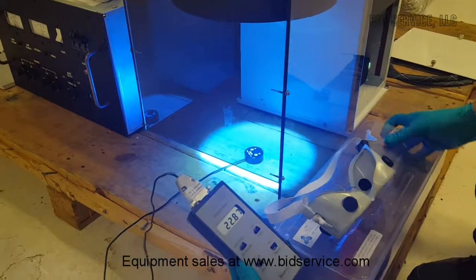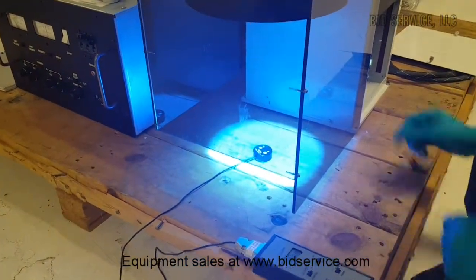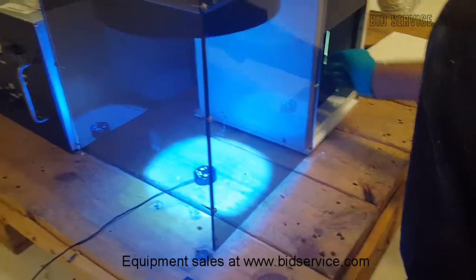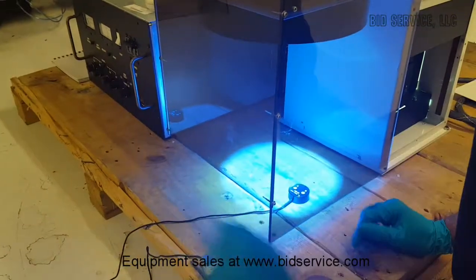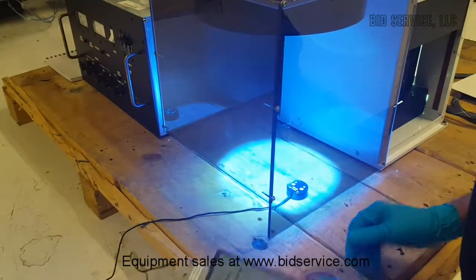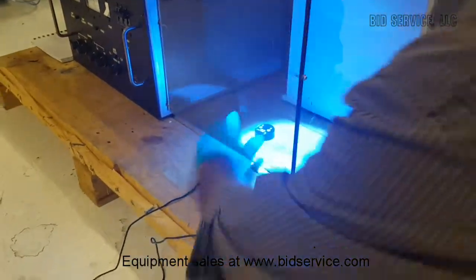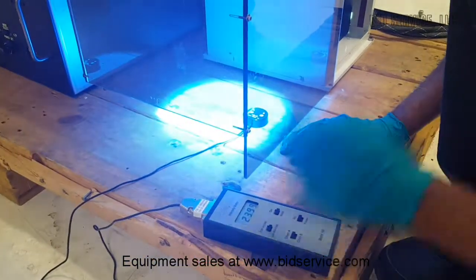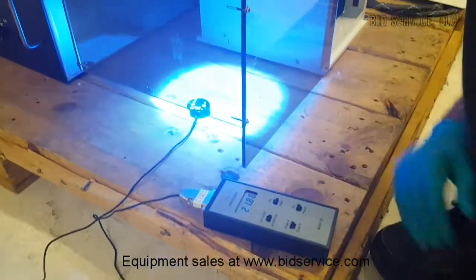The way the lamp can be adjusted and uniformity achieved is by moving the other two knobs, and the uniformity is measured at different points. If we position the detector at different points, we see that it is uniform along the x-axis and also along the y-axis.